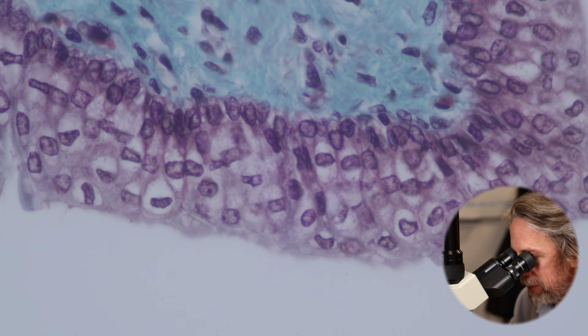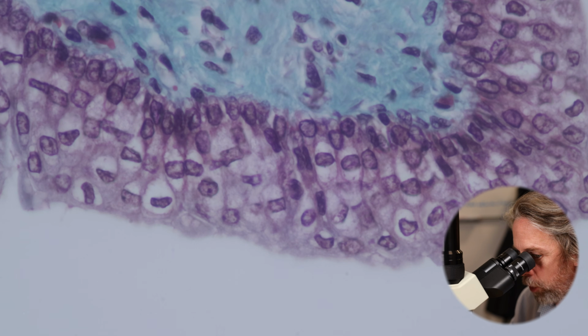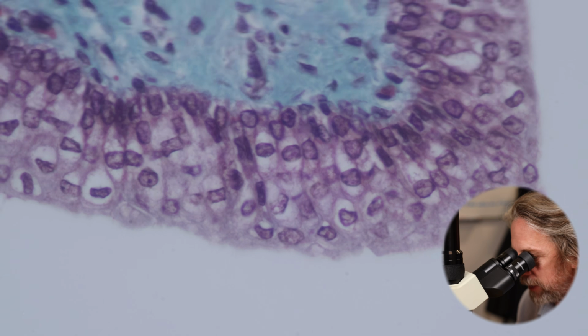The cells in the middle layer are really good at proliferating. So the stem cells make new cells, and then they proliferate and you get lots of cells. But the cells nearest the lumen, nearest the white, the superficial layer, these cells form an excellent barrier. They are all linked together tightly and they form a barrier between the urine and everything else behind them. So they stop the water, the salts, the nasty things that you're trying to excrete from your body. They form the barrier between the body and the urine, and that's why they're so special.